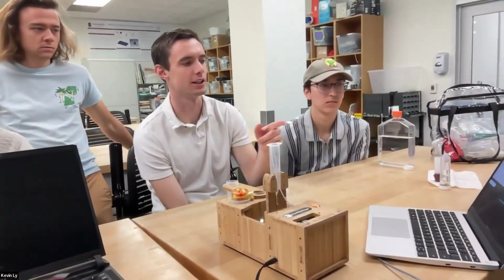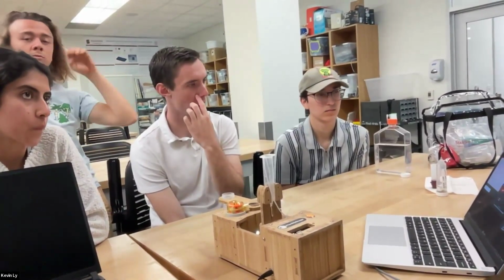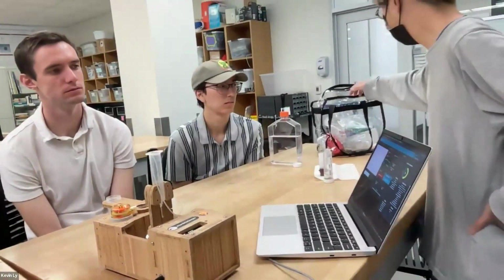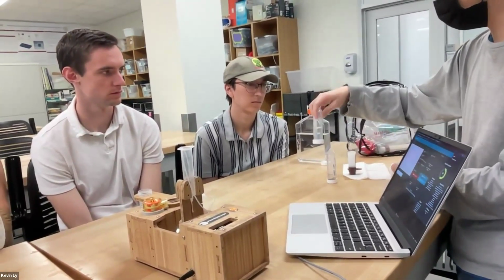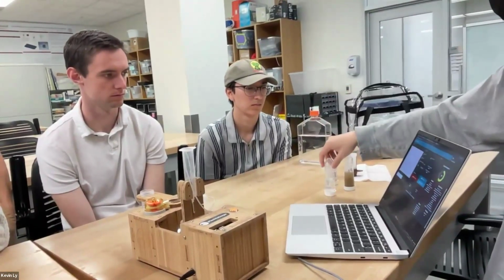Do you think you could tell a difference, from your eye, if it's a freshwater sample versus a saltwater sample? Oh, that's a good question. I think often saltwater samples will have different kinds of plankton that show up, but that really depends on where your saltwater samples are coming from. With freshwater samples, it also depends on how you collect them, because we got 3 samples from the same place in the lake. One was at the surface where there was pond scum. One was from the surface where it was clear water, and one was from the bottom where there was the sediment mud layer. This has almost nothing inside it, and it looks very similar to when you just get seawater and there's almost nothing inside it also.